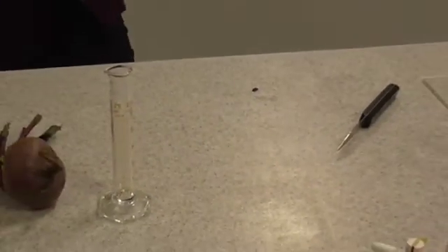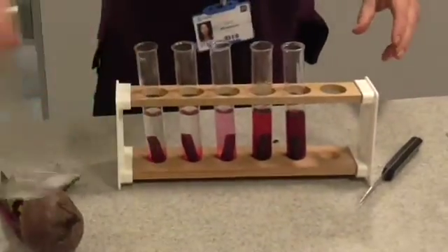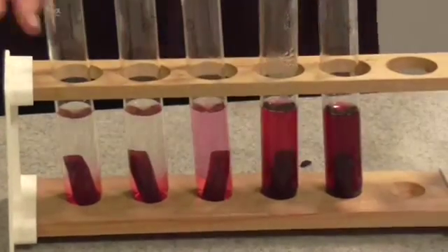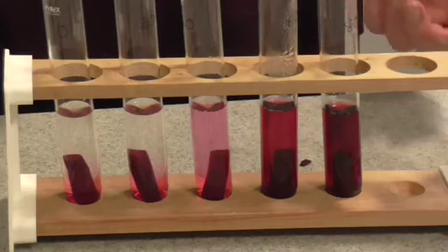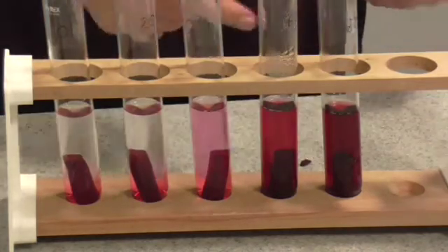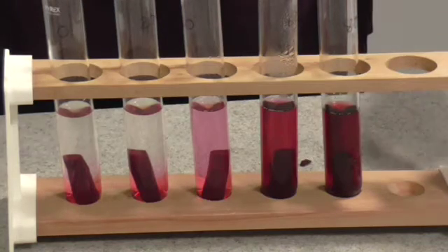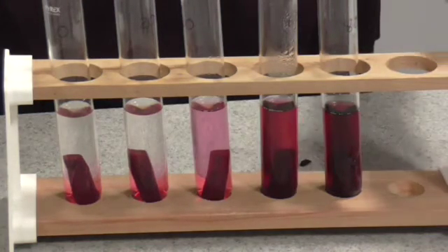After 20 minutes, when you remove your water from the water bath, you'll find that the samples look quite different. We can clearly see already that there seems to be some kind of correlation between temperature and the amount of anthocyanin that's leaked out of the beetroot. We now need to make that a little bit more quantitative, so for this we're going to use a colorimeter.